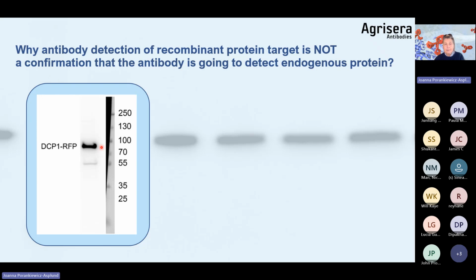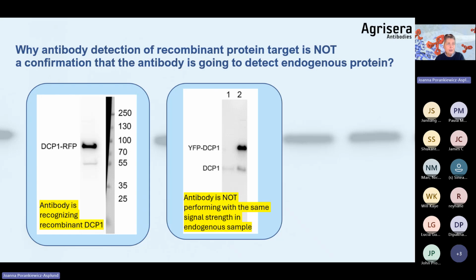And this is misleading because an antibody may actually recognize recombinant protein, but not an endogenous protein. There is much more recombinant protein often present in a sample, as you will see in this example. So we have an endogenous sample here, and then we have the same target protein present in the transgenic material. As you see, intensity is not the same. And one should not even compare it, because the level of that protein in the endogenous tissue is incomparable with what you will achieve in your transgenic material.